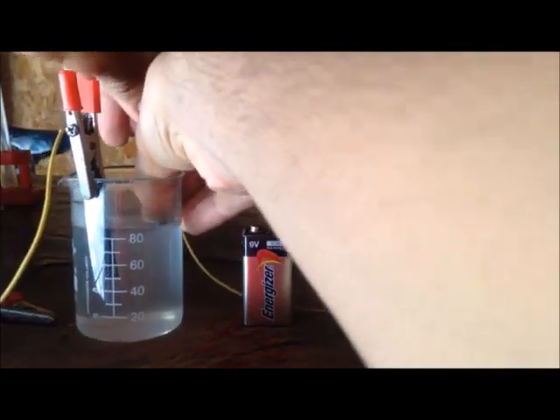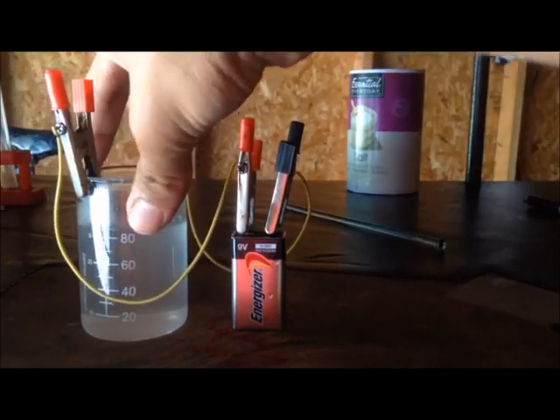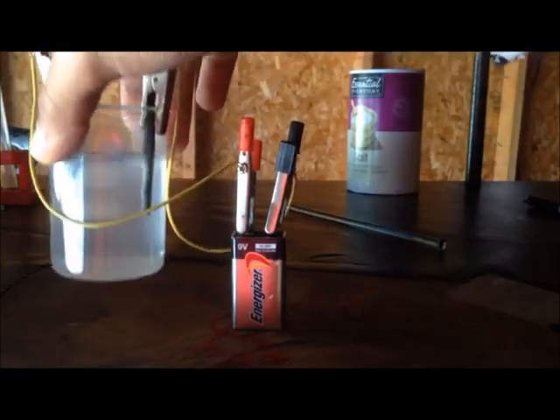You can notice the bubbles of gases around the electrodes—that tells us the reaction has started.